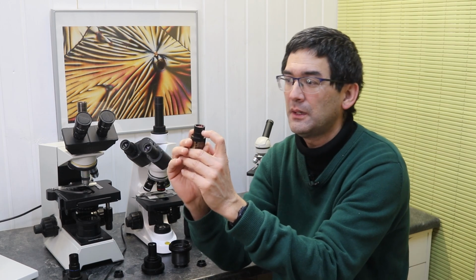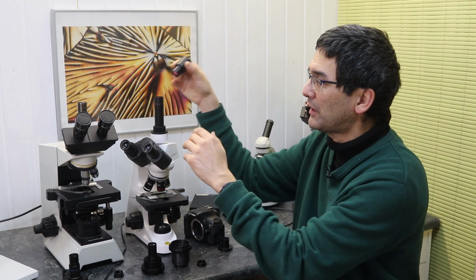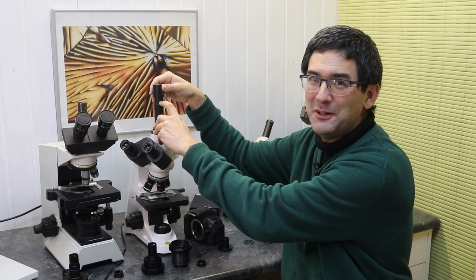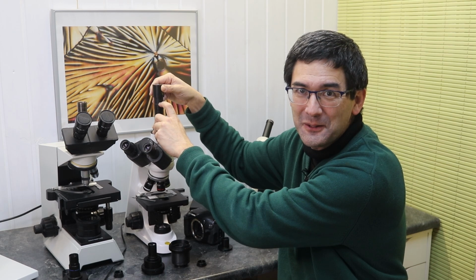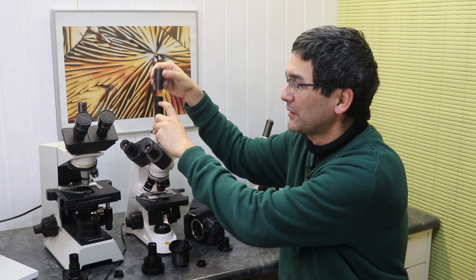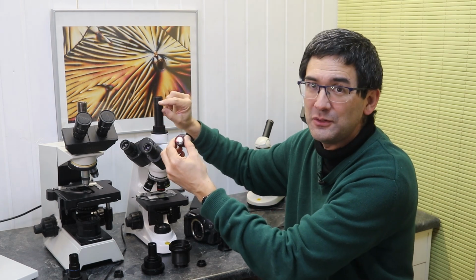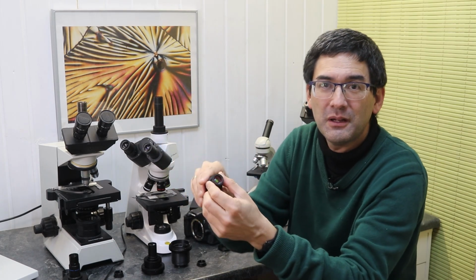It's a very compact design, and by inserting this camera in here, it will actually pick up the image right where it is projected. So by making the sensor sufficiently small and moving it down into the tube, it's not necessary anymore to have those optics in front. And that's essentially a solution.